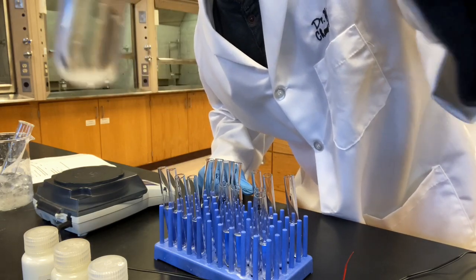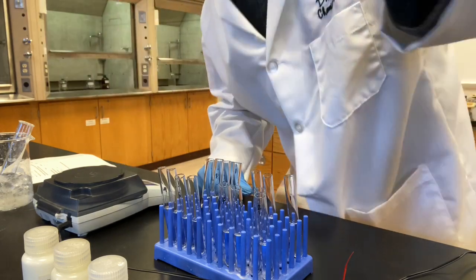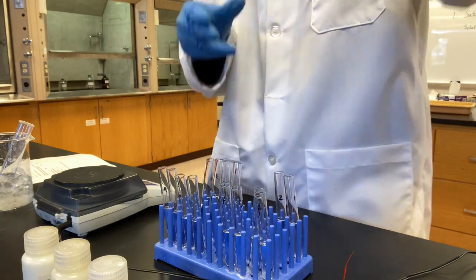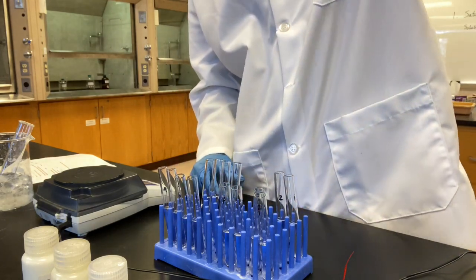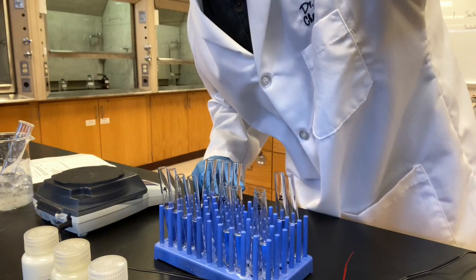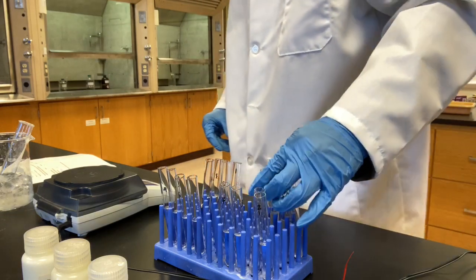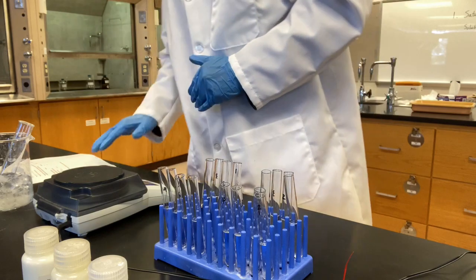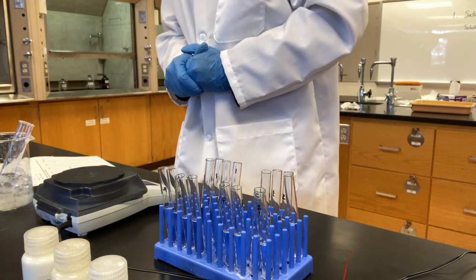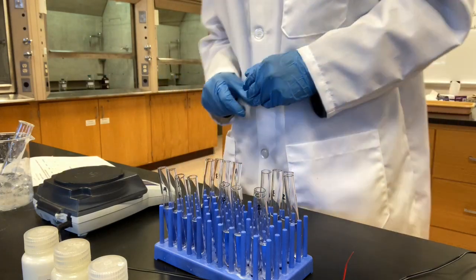The amount left is clearly less than what I put in. So slightly soluble. Acetone, nothing changed. Insoluble. Petroleum ether, insoluble. So table salt: in water soluble, ethanol slightly soluble, acetone insoluble, petroleum ether insoluble.